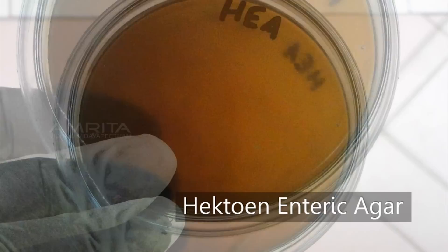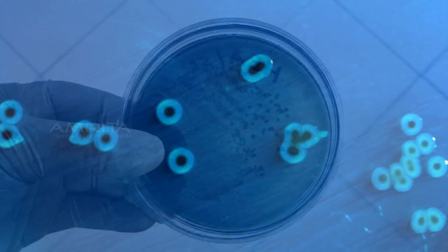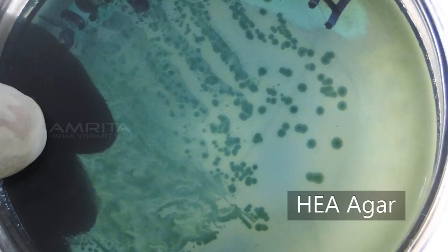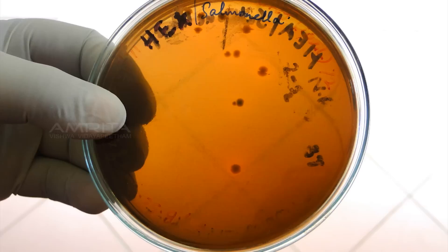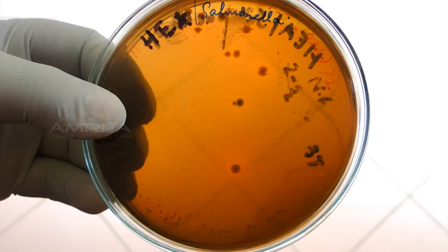Hektoen enteric agar is a moderately selective medium used for the isolation and cultivation of gram-negative enteric microorganisms, especially Shigella and Salmonella, from a variety of clinical and non-clinical specimens. On HEA agar, Shigella species develop into green-coloured colonies with darker blue-green centres, while Salmonella species appear as blue-green colonies with or without black centres.